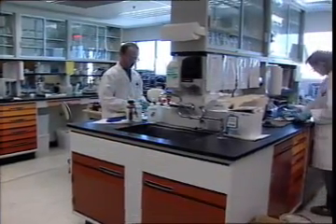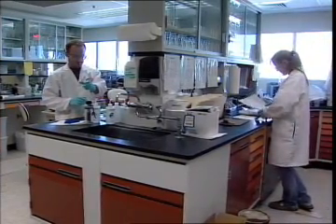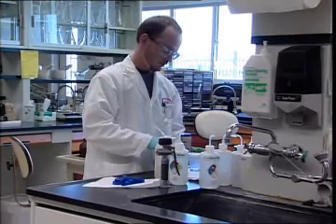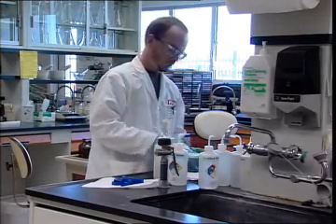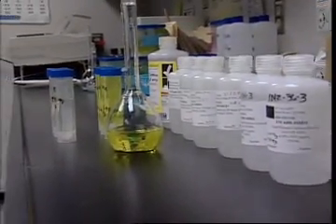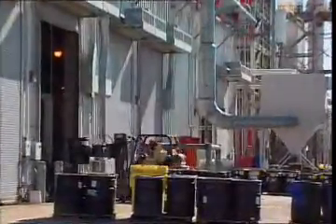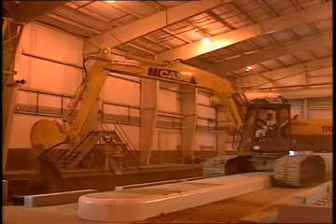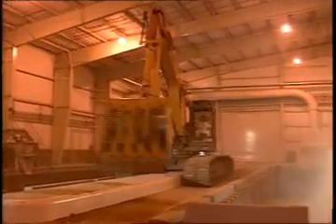Each TSDF has an analytical lab that checks to make sure all required information about the hazardous components in each incoming waste is correct. At the TSDF, lab wastes may be recycled and valuable components recovered whenever possible. When recycling is not feasible, organic wastes can be burned for energy recovery. Other organic wastes may be incinerated or treated in some way. As a last option, wastes are deposited in secure, specially permitted, leak-tight landfills.